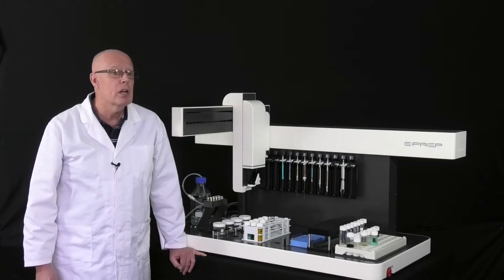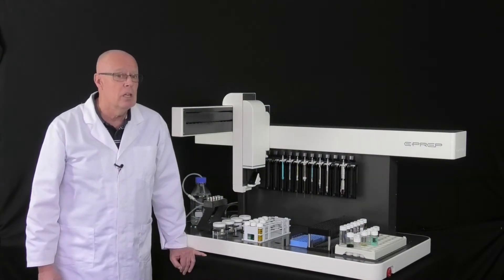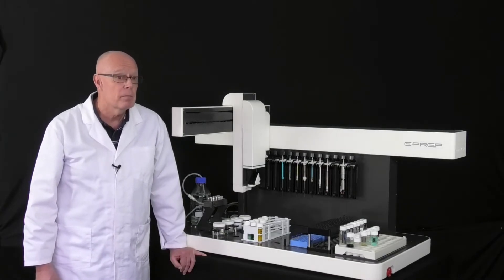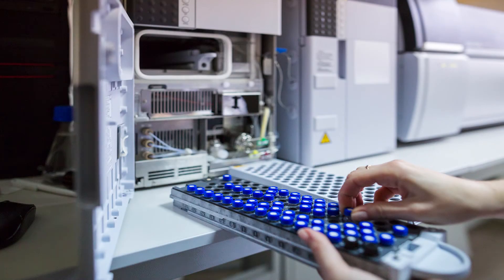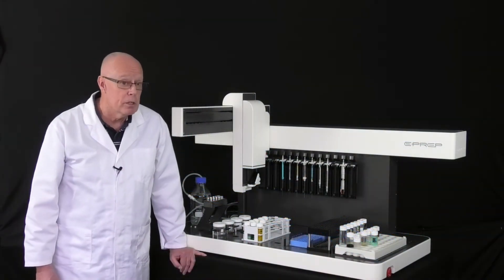Robotic operation is capable of orders of magnitude of improvement in reproducibility and accuracy. And because a robot can handle very small volumes, preparation can be done directly in the autosampler vial. This, of course, saves time and reduces waste.